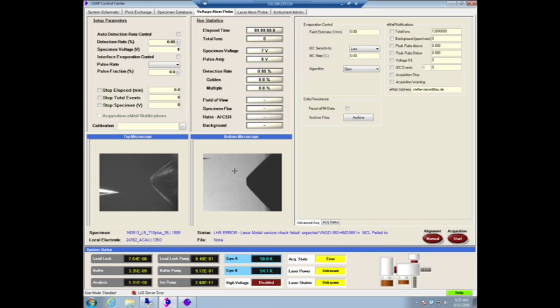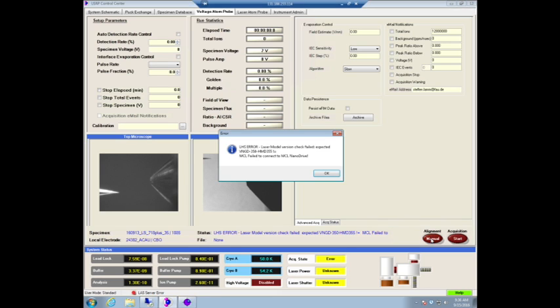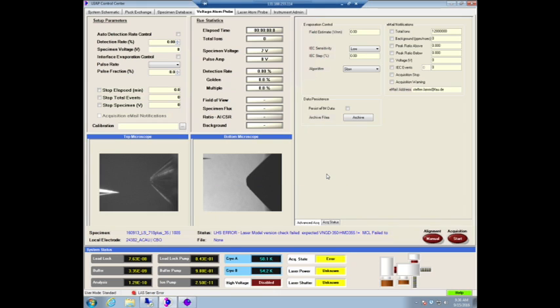Something we haven't been able to see in the microscope during the polishing. And that is the error I was talking about with the stage before. Of course, that's the Windows 95 effect. If you remember when Bill Gates was presenting Windows 95, it crashed while he was doing it live on TV. And of course, it's happening to us right now as well.